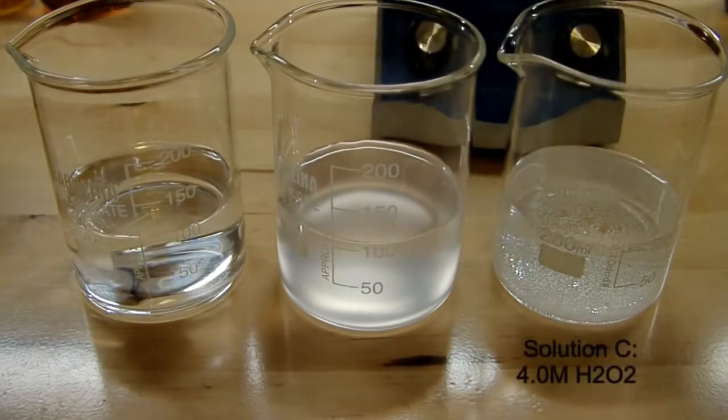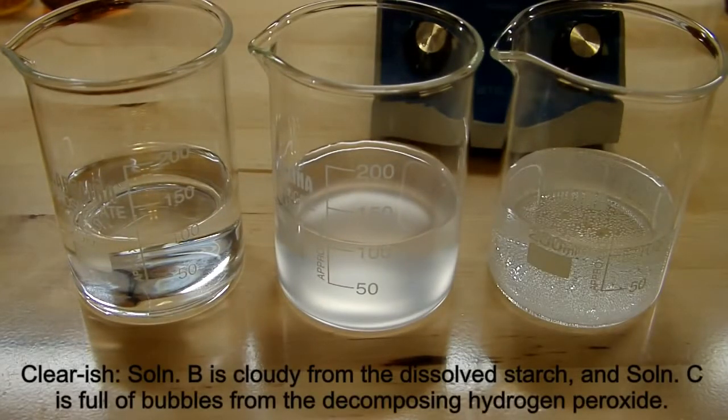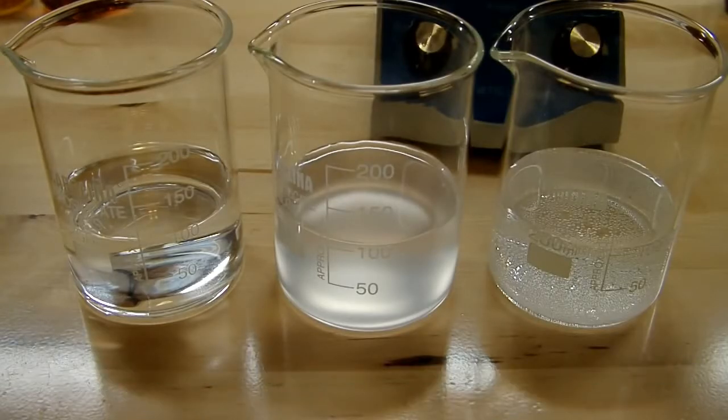And solution C is hydrogen peroxide, 4.0 molar hydrogen peroxide. So I diluted down some 35% peroxide that I had to get this concentration. So these 3 clear solutions I'm going to combine into one, and we'll get to see some really interesting chemistry and color changing reactions.